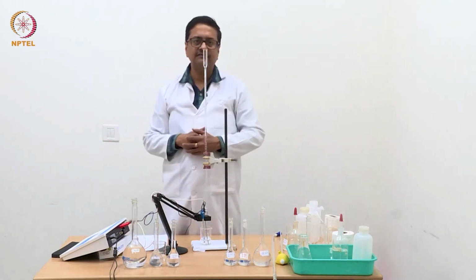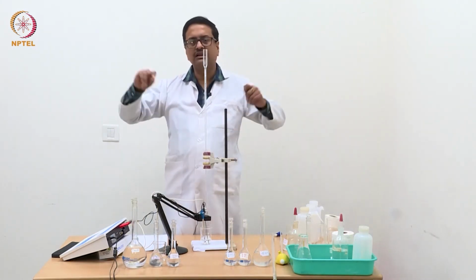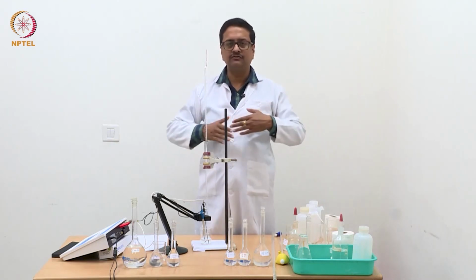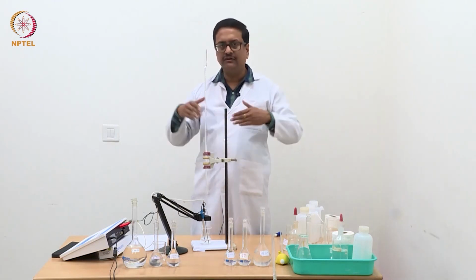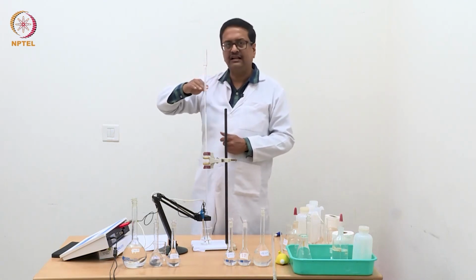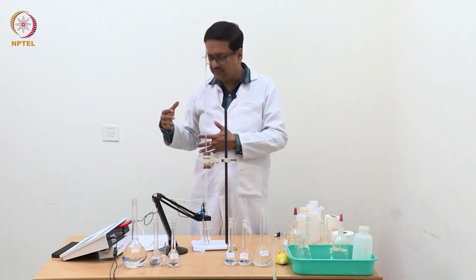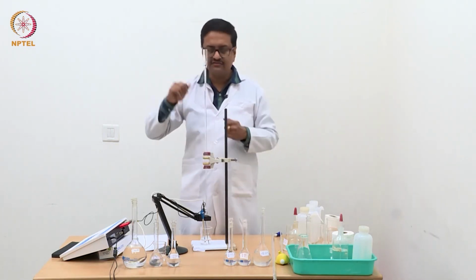These points which are very close to the neutralization points, we need them very accurately to draw the actual graph, but these points will not be useful for finding out the end point, as you know that we will have to draw a tangent through all the points which are falling in the straight line. So when we do that, we will see that these points which are slowly changing from constant to an increasing trend, these points will not fall in the straight line. So we will not need these points for accurate endpoint determination, but to show the trend how it changes, we will need these points.